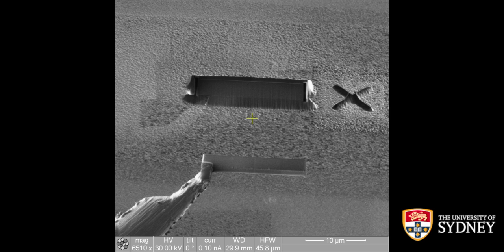The whole assembly should then look something like what you can see here on the image. So the lift out piece is attached to the micromanipulator needle with a little platinum deposit in this case. What sort of deposit or deposition conditions doesn't matter very much. This weld doesn't need to endure very high stresses or anything. So just make sure that you've got a decent weld, that it's not gonna fall apart when you're trying to move it around or anything.